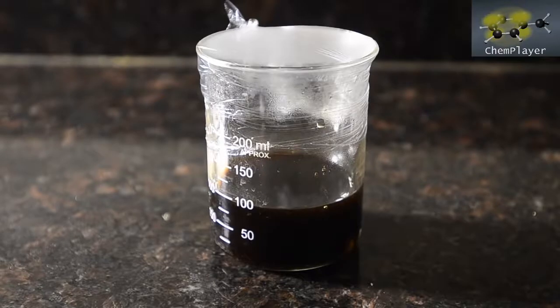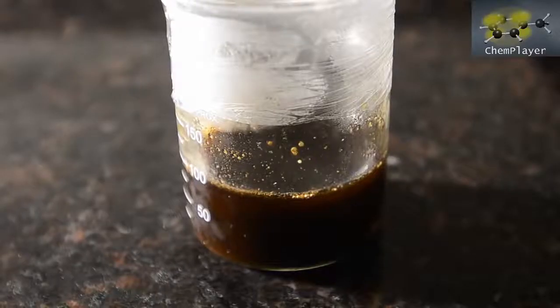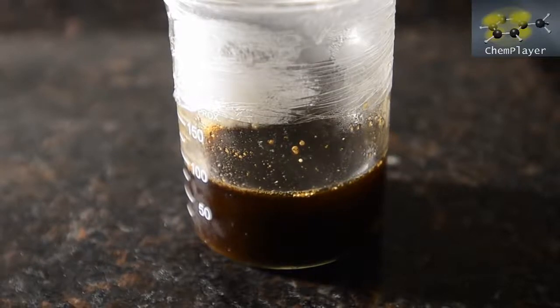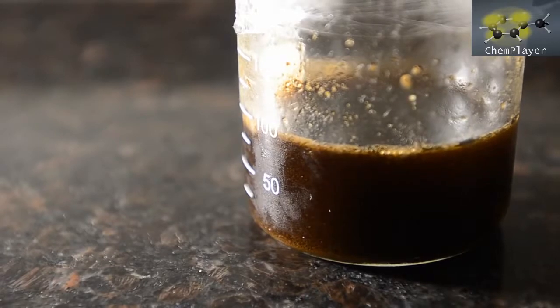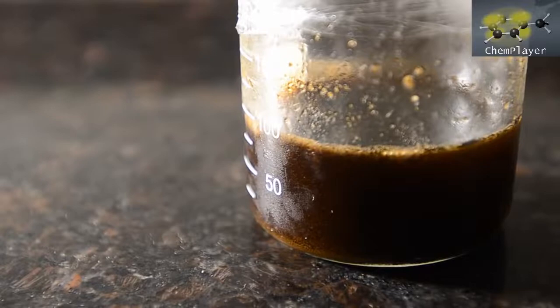So we covered up the mixture and now we're going to chill it down for a few hours in order to see if we can get any product coming out. P-aminophenol is soluble in warm water but pretty insoluble as the temperature drops below about 10 to 15 degrees. As the liquid chills you can see yellow crystals forming.